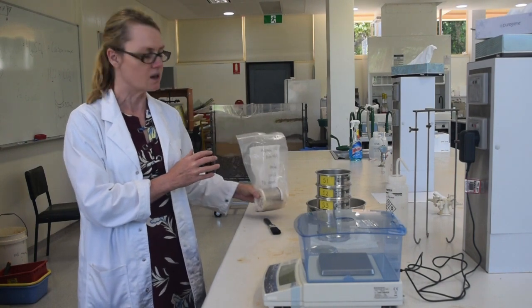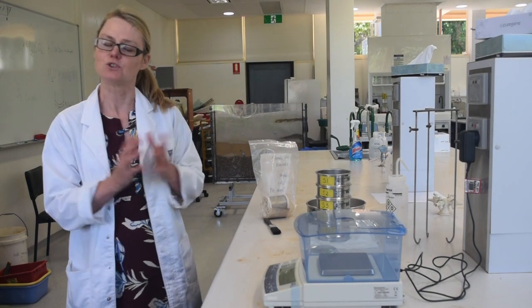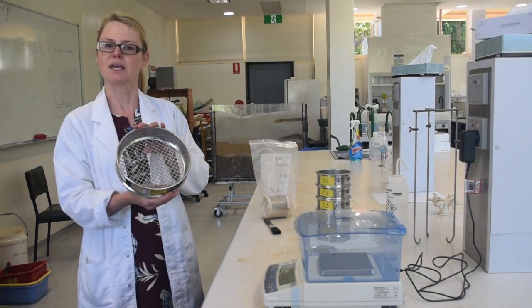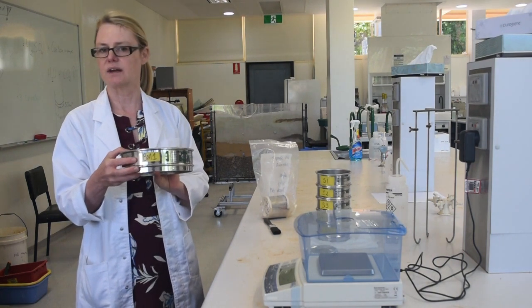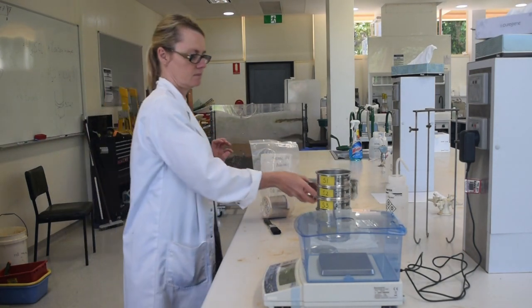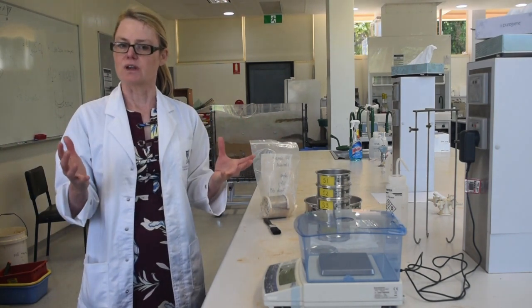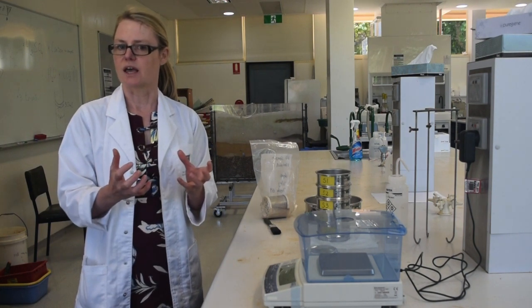Once you've determined your bulk density, the next thing you're going to have to do is break up this core using this particular sieve. You're going to be breaking it up into aggregates that are around 8mm or less. For the remainder of the lab, you're now going to be using this broken up soil sample.